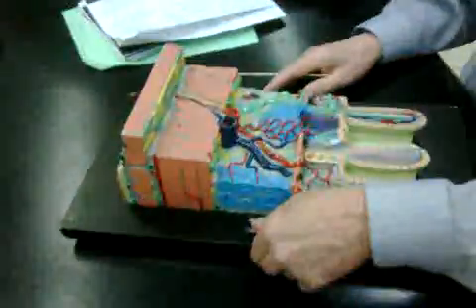The muscularis circular. The circular muscles are here. You have to kind of picture them rotating around this way, right? So they're the circular ones. And then the longitudinal ones are here. They go lengthwise. And then you have the serosa, which is this layer here. Serosa. Connective tissue layer that supports the outer part of the small intestine.